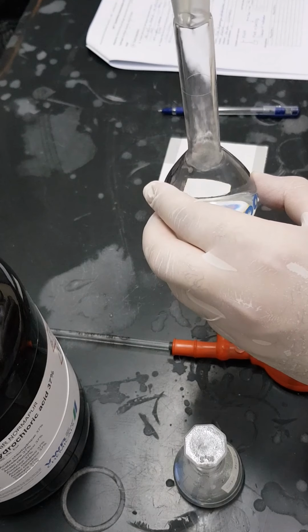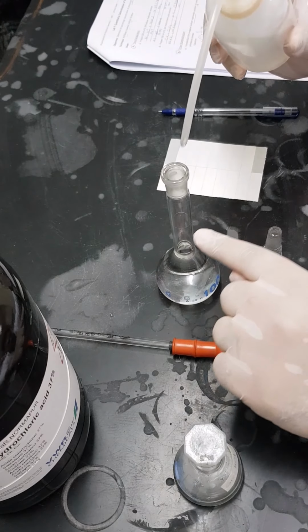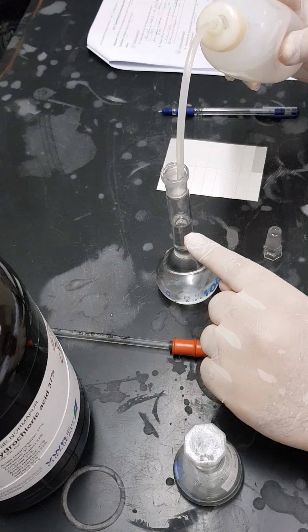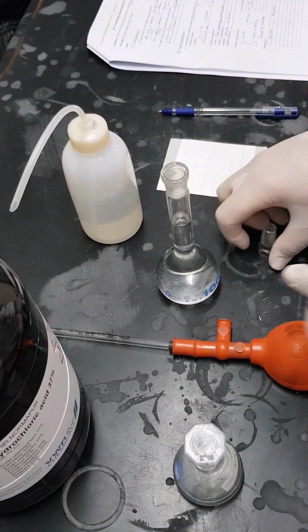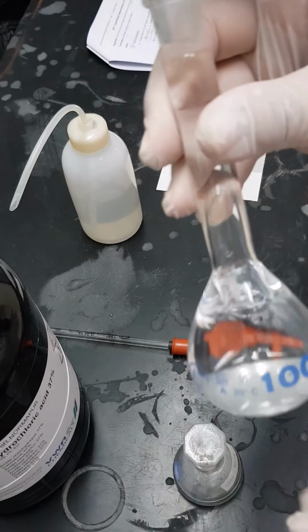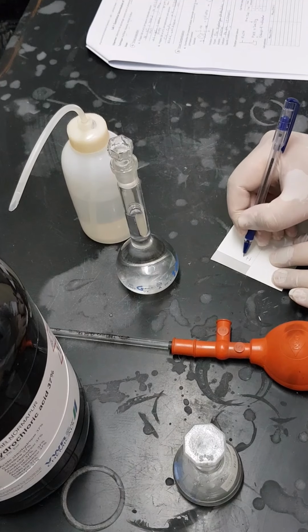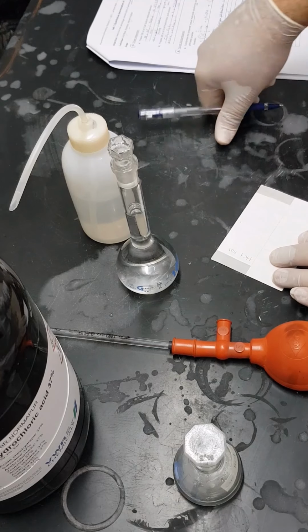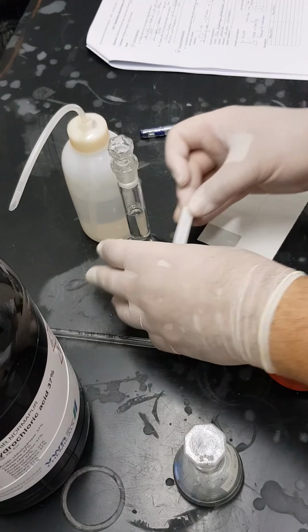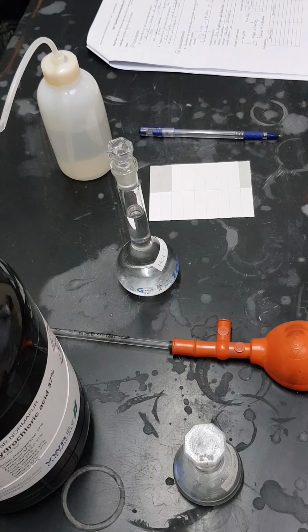So now I have to just fill it, and I have to put it on a flat surface, and I put my eye on that level, so I will adjust the meniscus properly. I think mission accomplished. Now we are done. Once again, we are going to mix it properly. Then I'm going to write a label, and I will call it HCl solution. So now my HCl solution is ready, and I proceed to the next step.